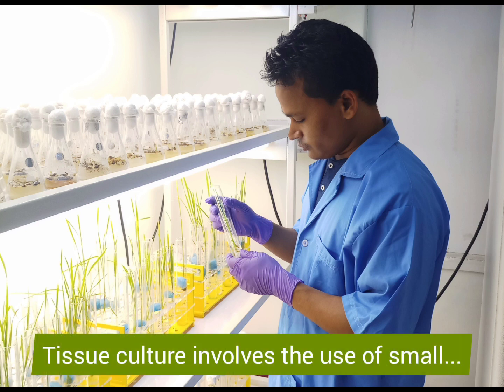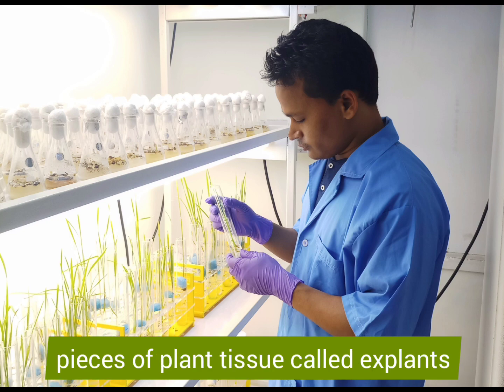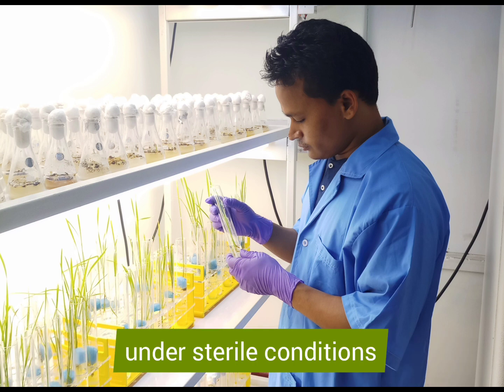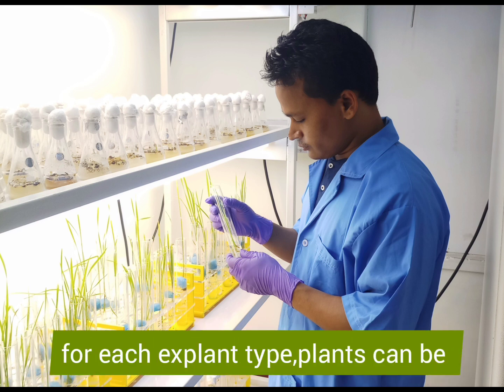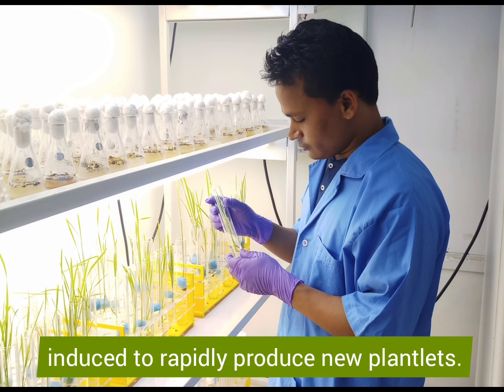Tissue culture involves the use of small pieces of plant tissue called explants, which are cultured in a nutrient medium under sterile conditions. Using the appropriate growing conditions for each explant type, plants can be induced to rapidly produce new plantlets.